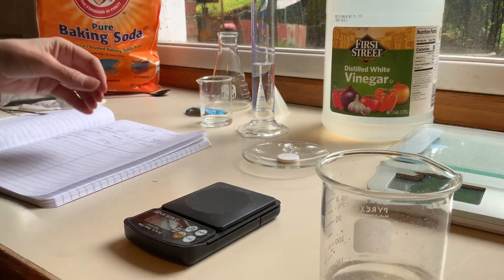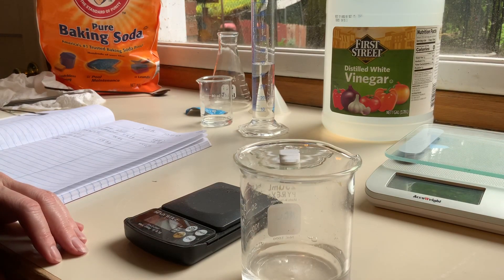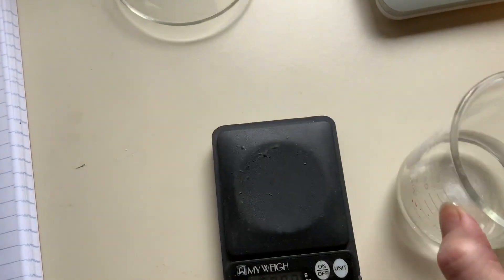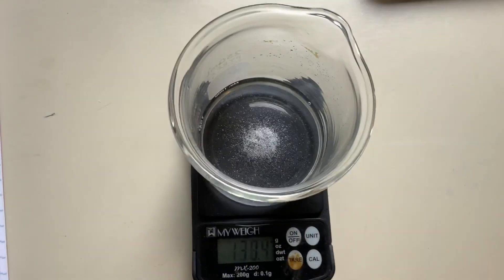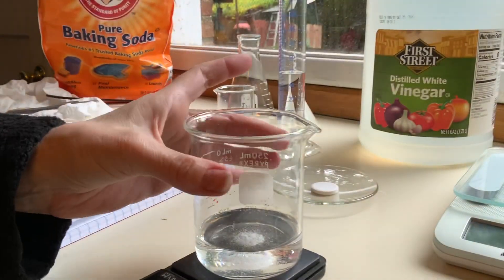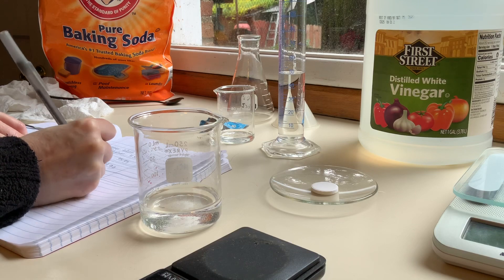It's slowing down. I'm going to give it another little swirl just to make sure. I do see some solid in there — the black background is helpful. I'll put the beaker on so you can see all that solid stuff that didn't dissolve. And there's our mass: 161.9 grams — beaker after reaction, 161.9 grams.